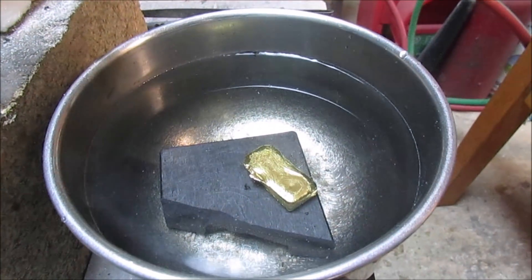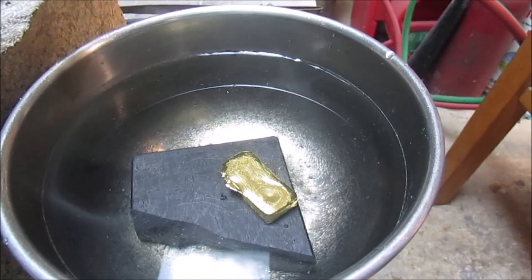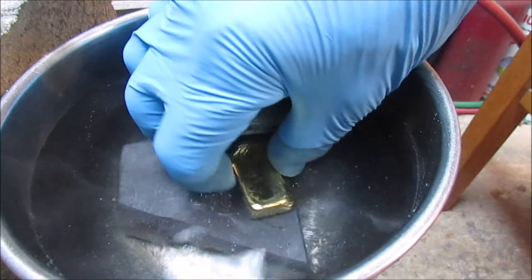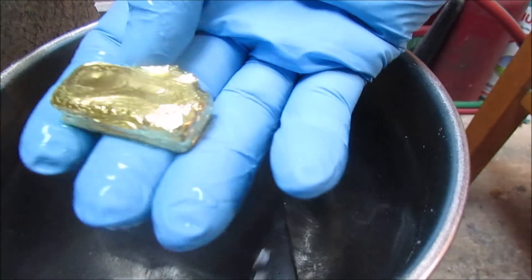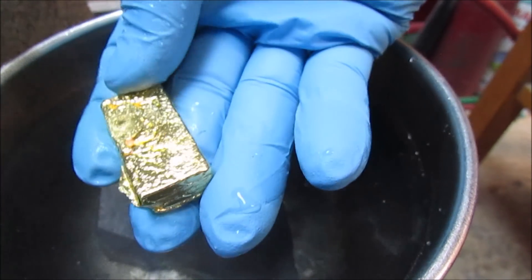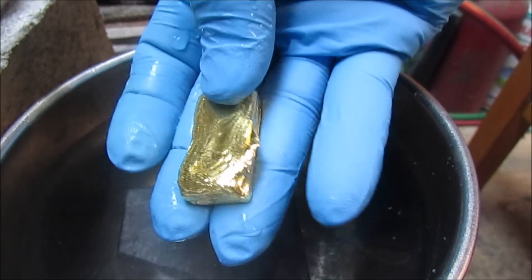Alright, we had to break the mold to get that out of there. Some flux came over with the pour and glued the bar into the mold.